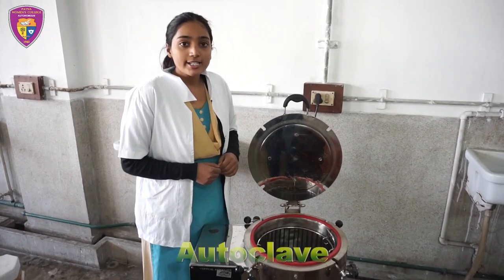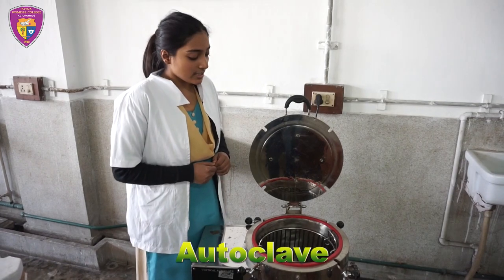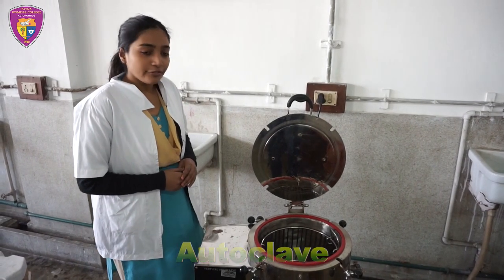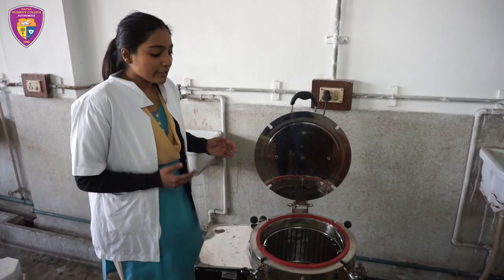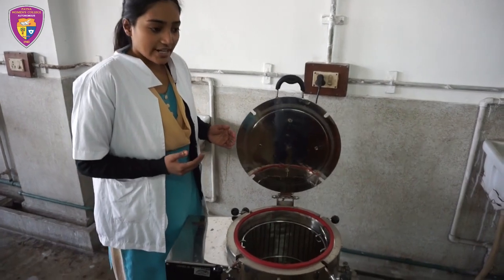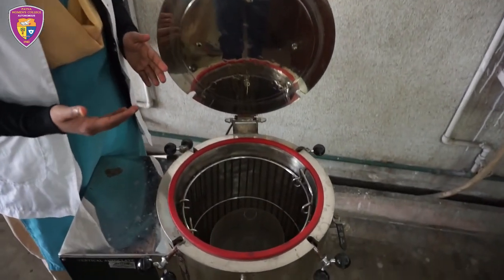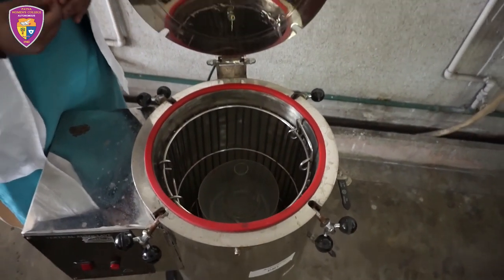The autoclave works at 121 degrees Celsius and 15 lbs pressure for 15 minutes. It is used mainly for the sterilization of different equipment, glassware, plastic ware and media.